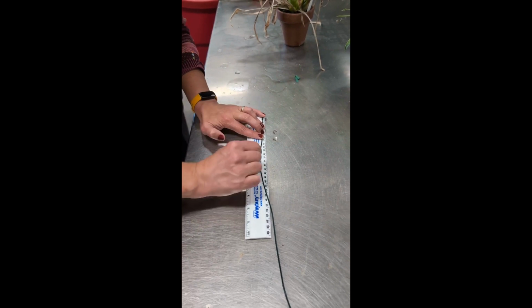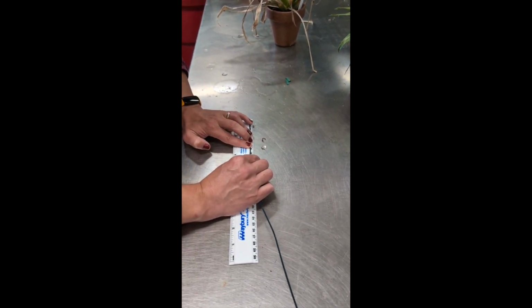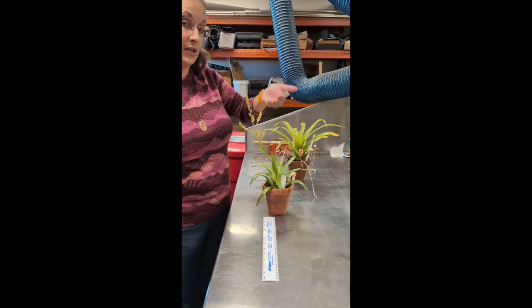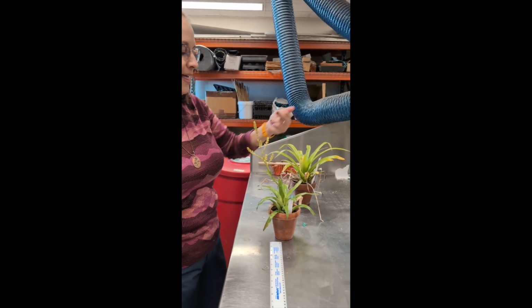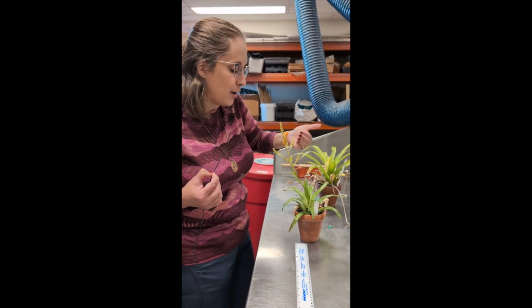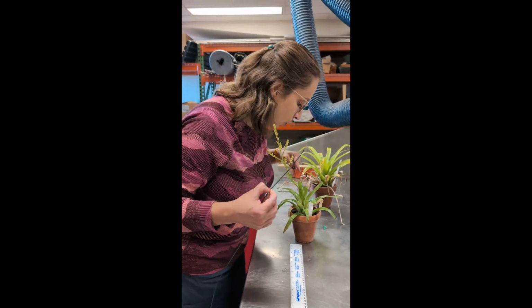Again, I'm lining it up. 127.5, new pinch mark. Back to my same individual, and I'm looking at leaves younger or more to the inside, often lighter in color than that. So you have to really look at the order in which they were built, how they're spiraling and nesting on each other, and go in order.